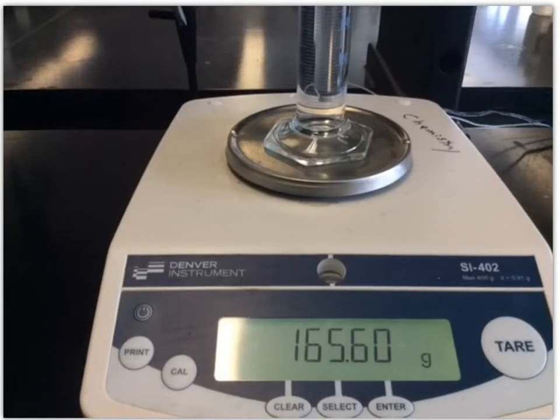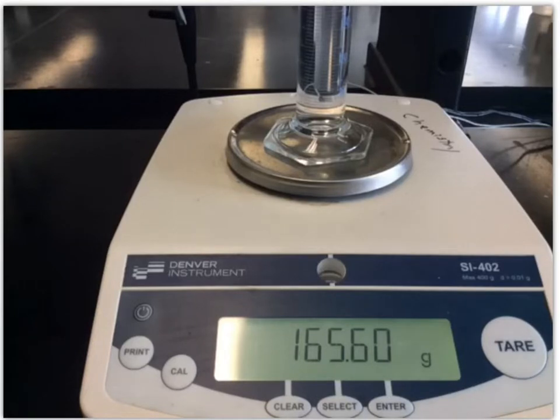Whether I measure 10 mils or 15 mils or 20 mils, it should always come out with the same density. Of course, what you'll notice on the trials is it's going to be a little bit different because there's always some experimental error. Okay, so we have a mass now of 165.60. Now, I want to point out, I didn't weigh this before I added that sample, at least not right before, but our final mass from trial one is our initial mass for trial two. So you can transfer that final mass from trial one to initial for trial two, and then write down this 165.60 as the final mass for trial two.